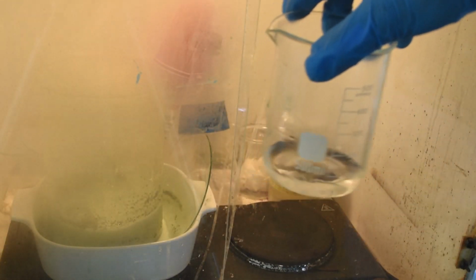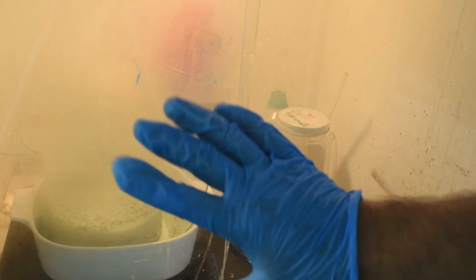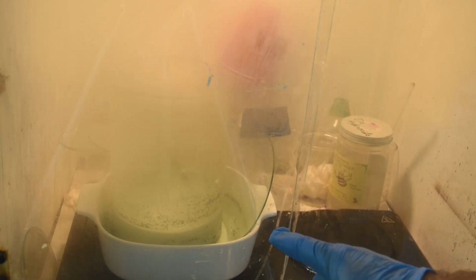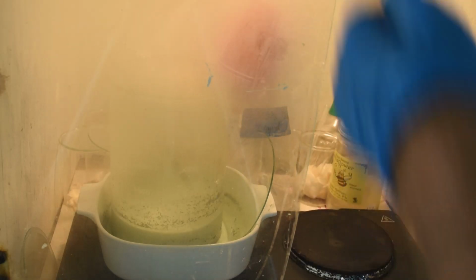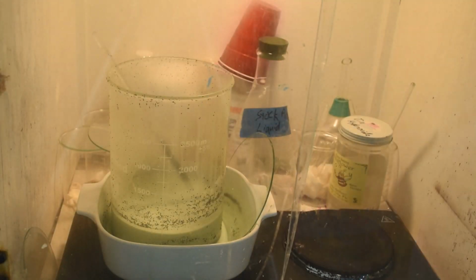Well, that was a delayed reaction. I didn't even put that much acid in. That was only a few milliliters. But we've caught it all in the Corningware dish. I'll wash it once everything calms down, cools down. Look how steamy it is inside the fume hood. Once everything calms down, cools down, I will dump the contents of the Corningware dish back in the beaker, and we will go again. But check this out. Check the color. That went from very slightly blue-green to quite blue-green very quickly. Okay. Let me let that cool down a little bit, and then I'll deal with it.